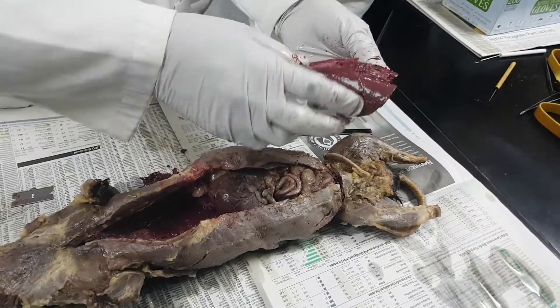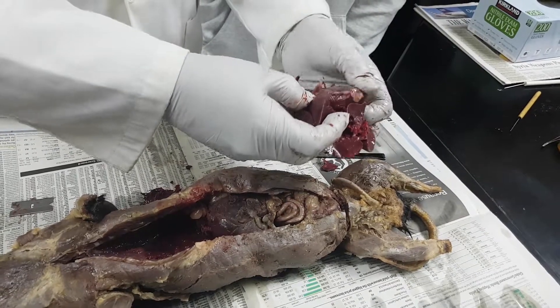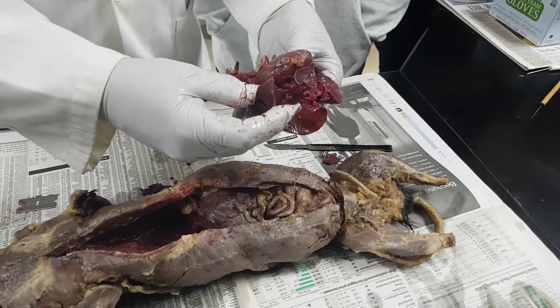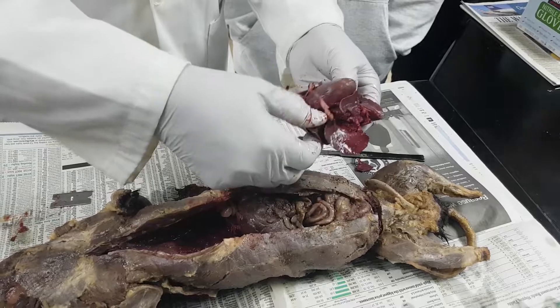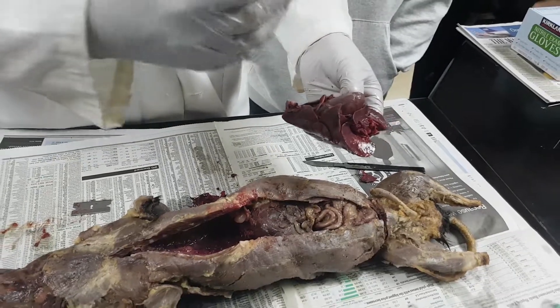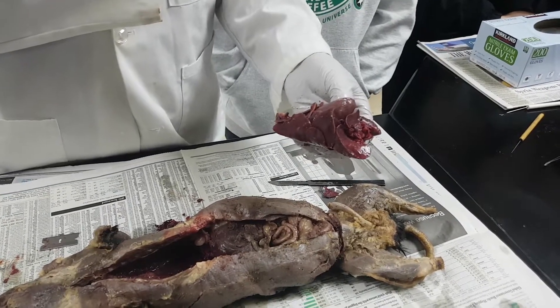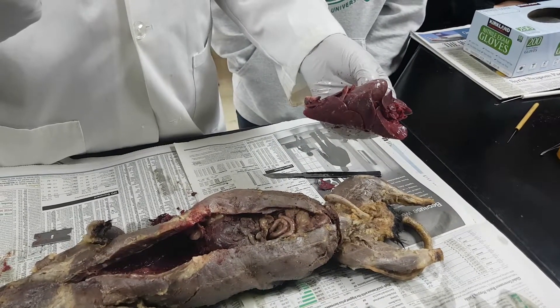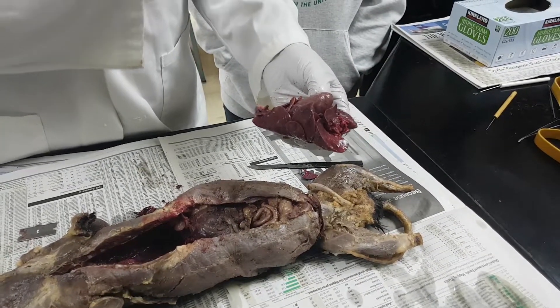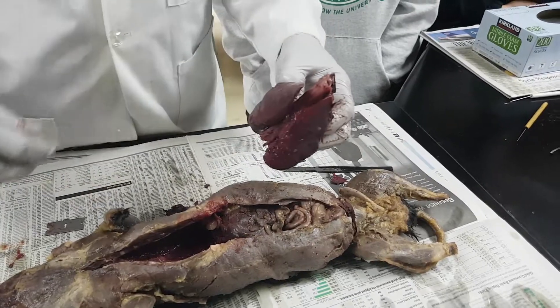This is upside down; this is right side up. And you can see the heart in the middle — see the heart right there? What are these things I'm holding on to? Lungs. I want you to notice that there are two lobes on this side and then there are three lobes over here, and that's because the heart is over to one side. When you put your hand on your heart to say the pledge, that's where the heart is — a little bit more to that side. So this side has three lobes and this side has two lobes because the heart gets in the way.